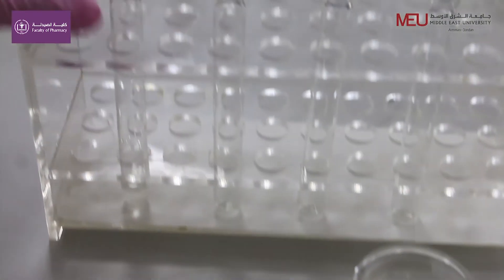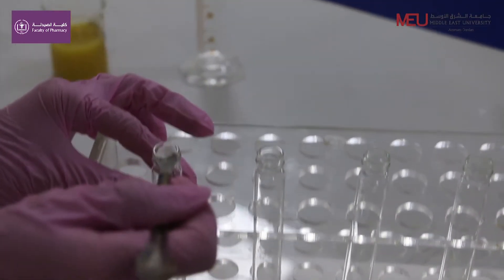To 1 ml of readily prepared ascorbic acid solution, add a few crystals of sodium bicarbonate. You will observe carbon dioxide gas.